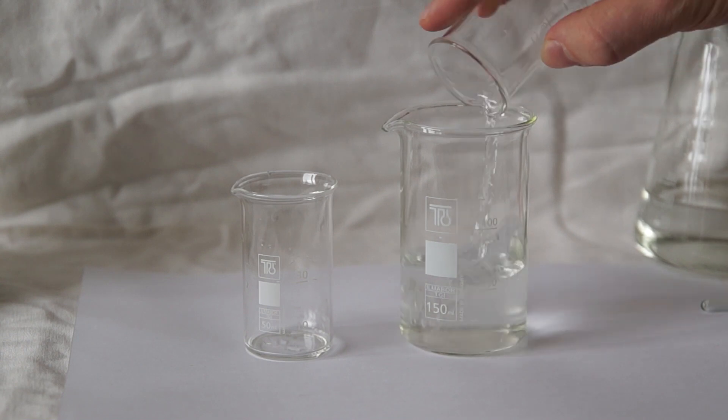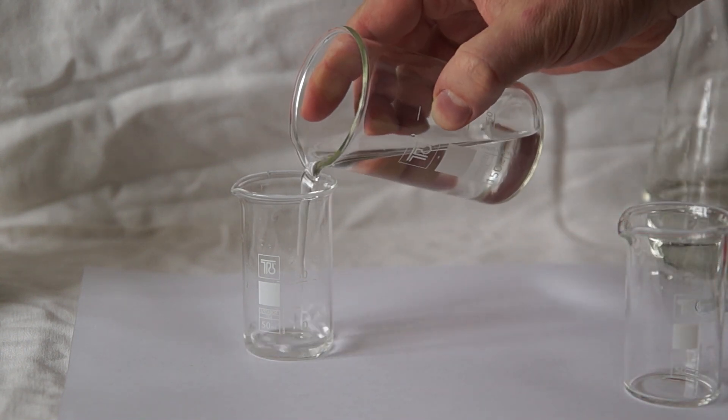This reaction is quite beautiful and spectacular. You can play long enough with it.